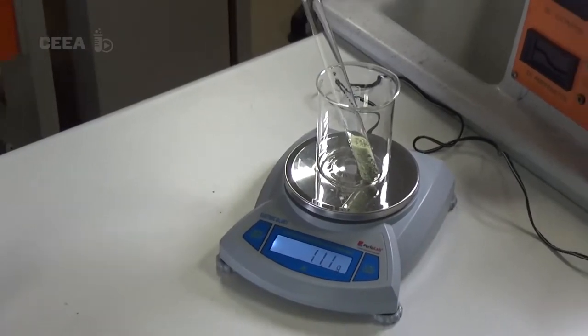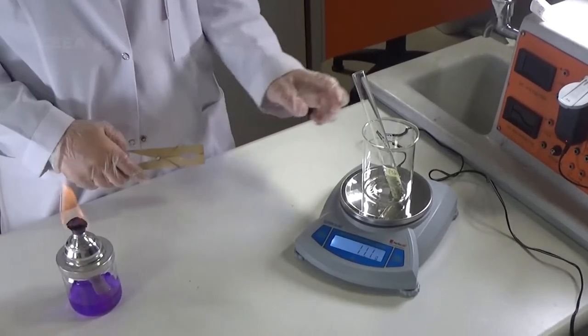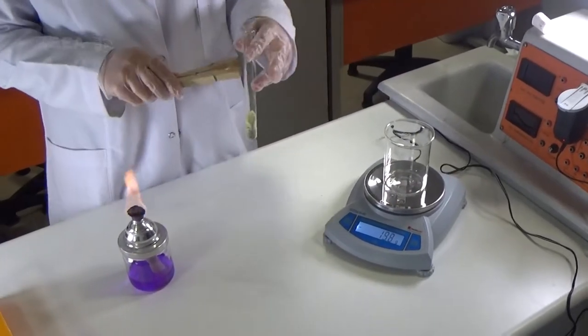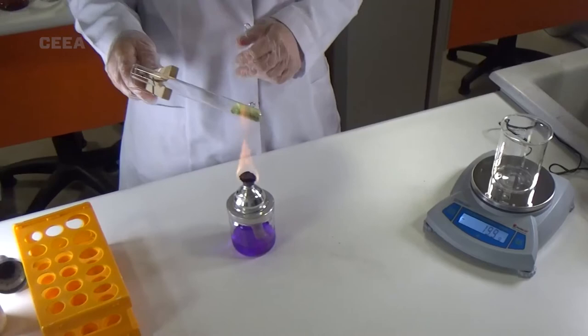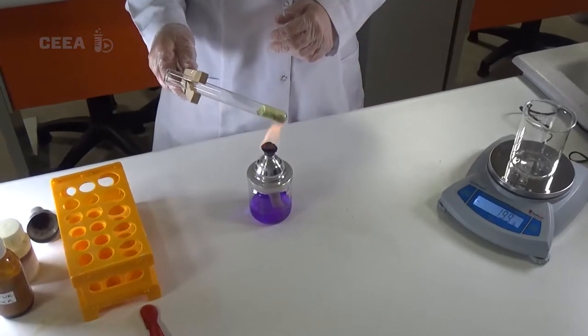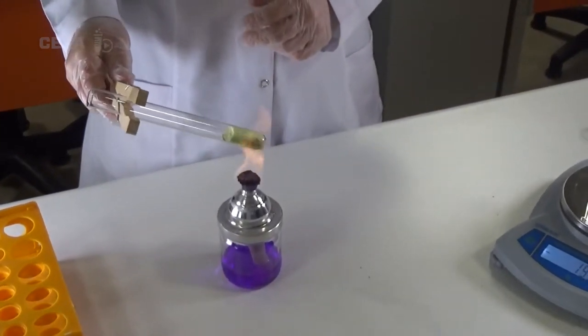The spirit stove is lit. The test tube is then taken with the tube holder and heated. It is put on the spirit stove.